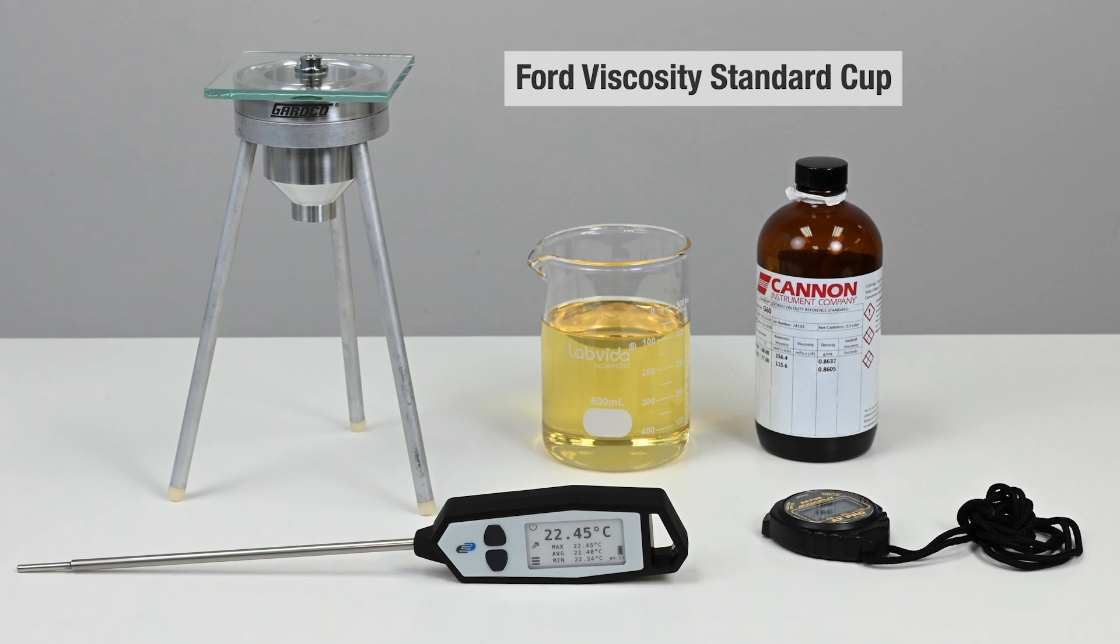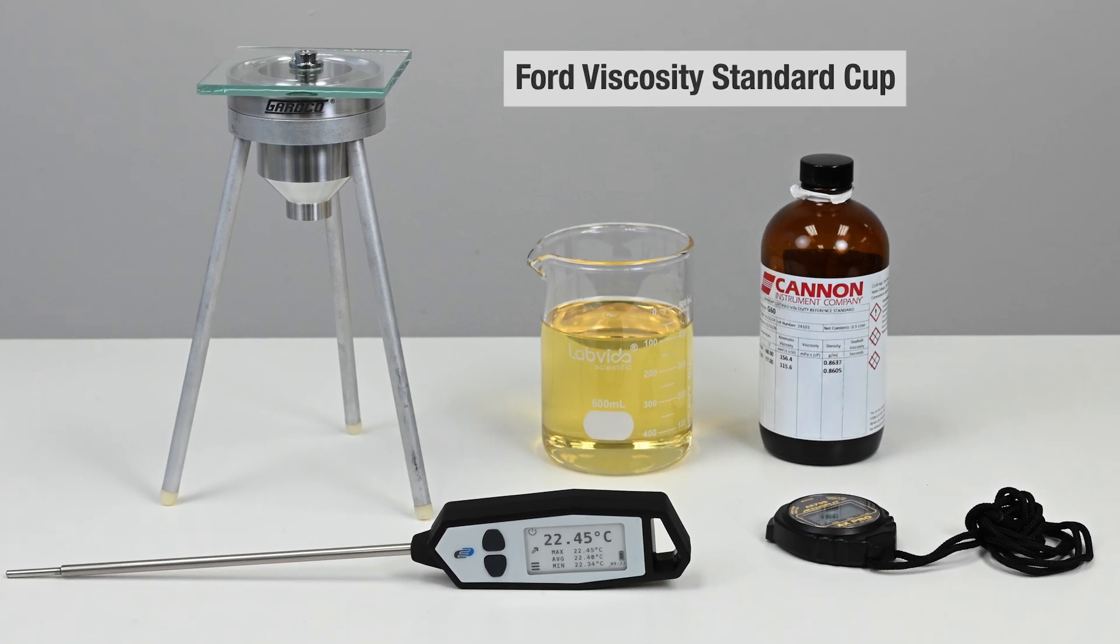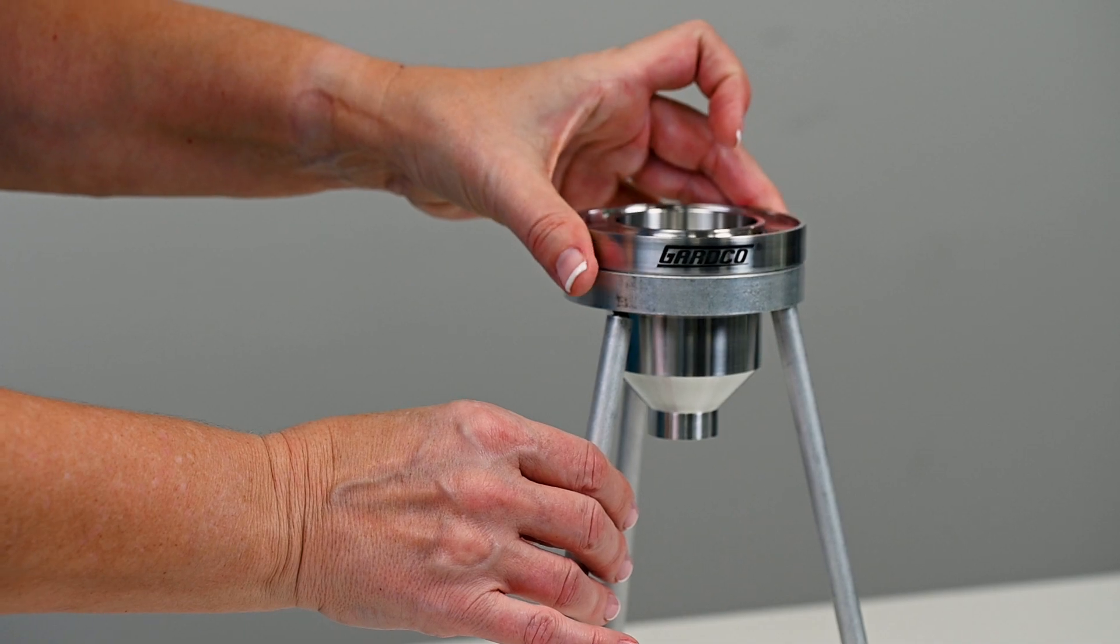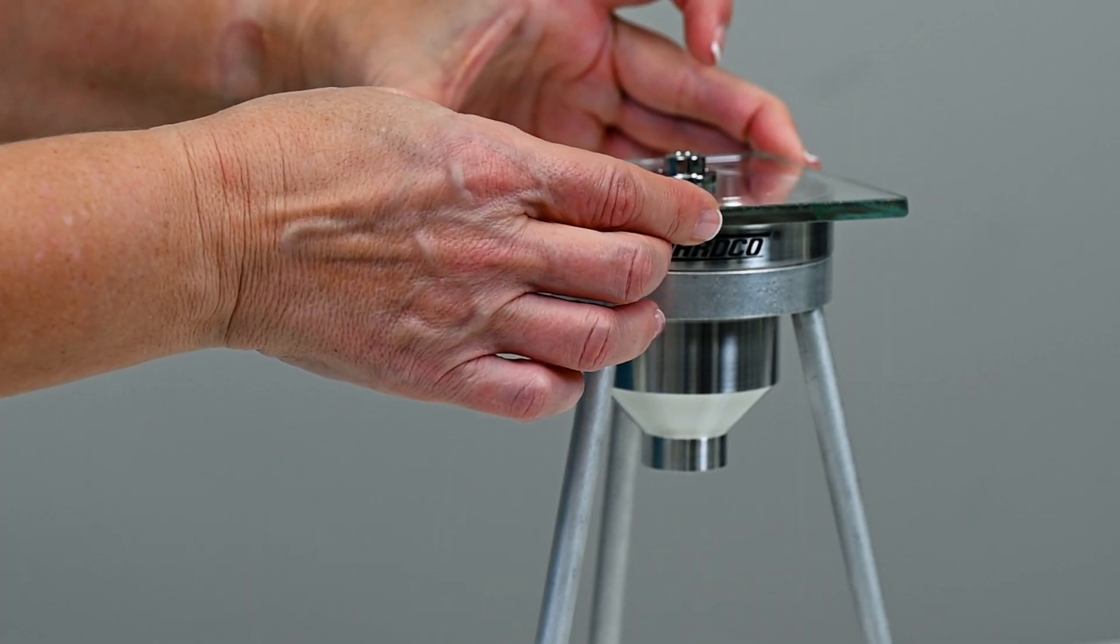Select the standard viscosity cup that will provide readings which are well within the cup range. Place it into its support stand making sure that the cup is level.